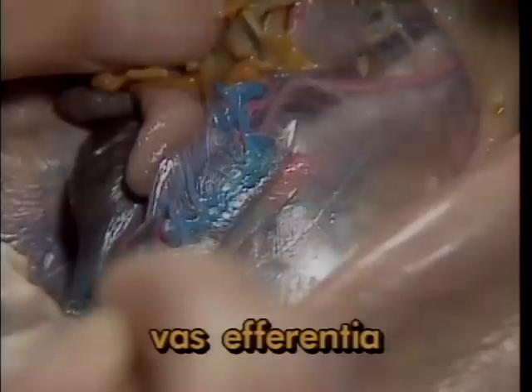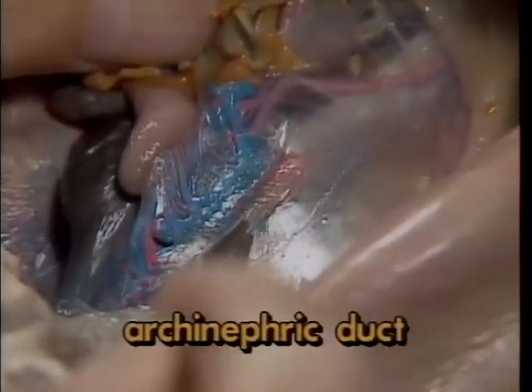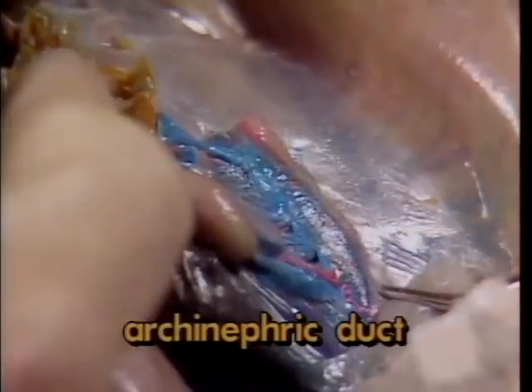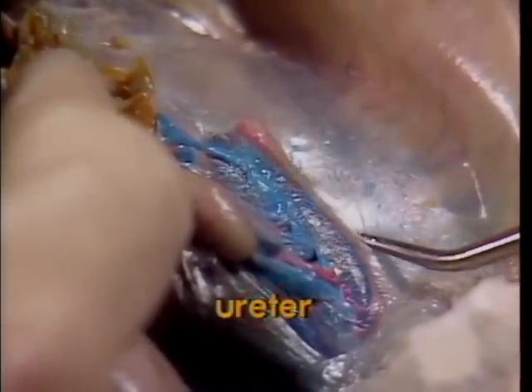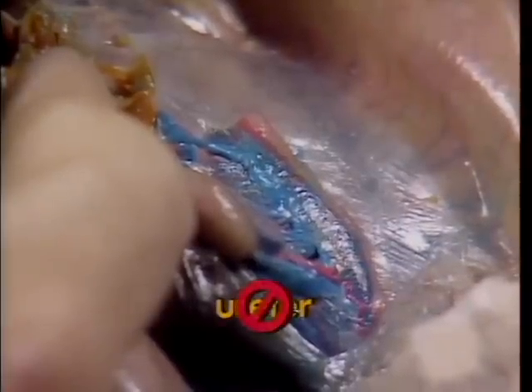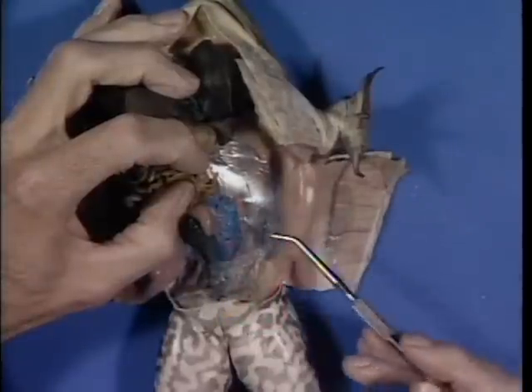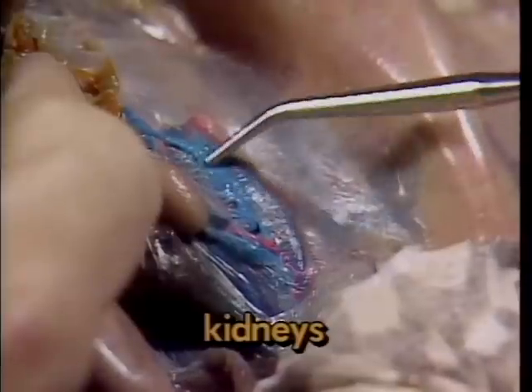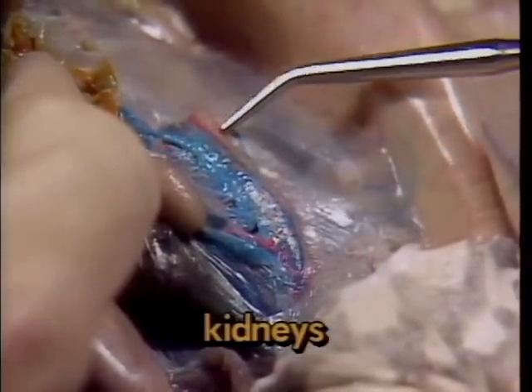From the testes, sperm are transported through a series of small ducts called the vas efferentia into a single larger duct known as the archinephric duct. This duct is often misnamed the ureter, which is not seen in amphibians, but does occur in reptiles, birds, and mammals. The archinephric duct is the same one which removes urine from the kidneys in both males and females. It lies here, along the lateral border of each kidney.